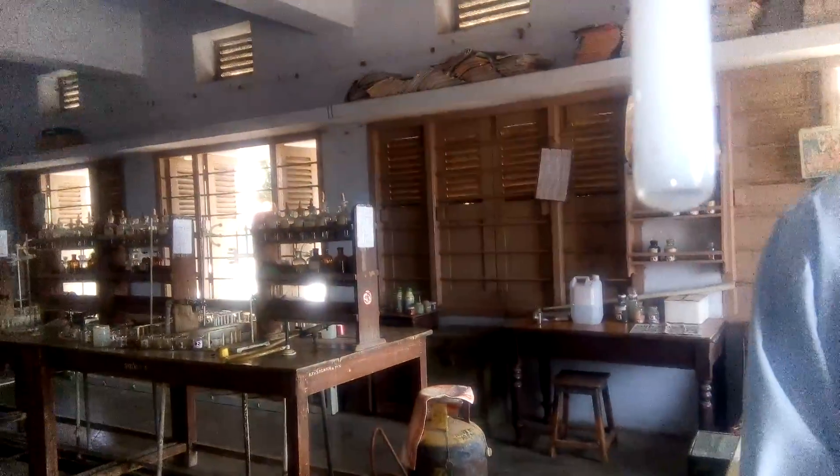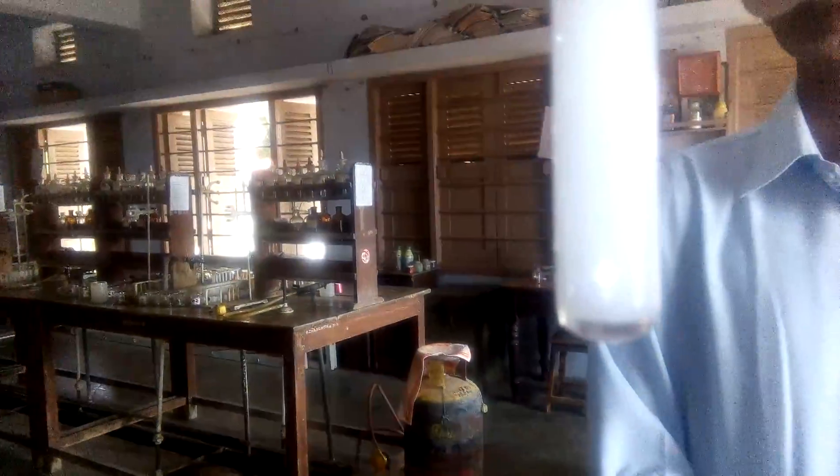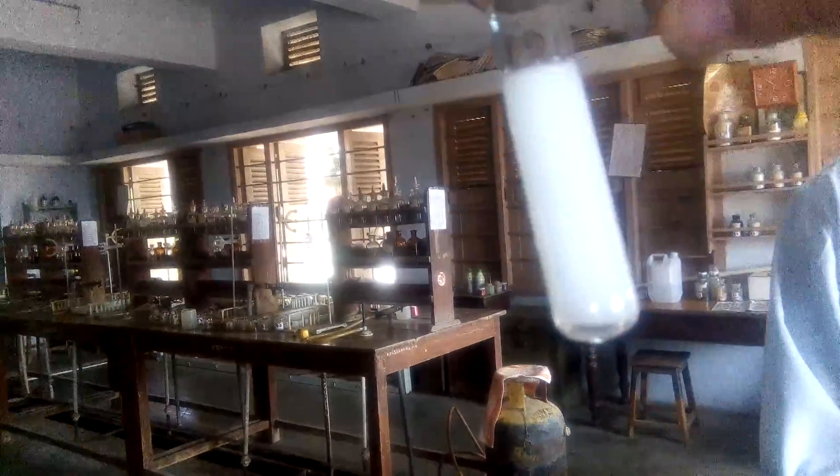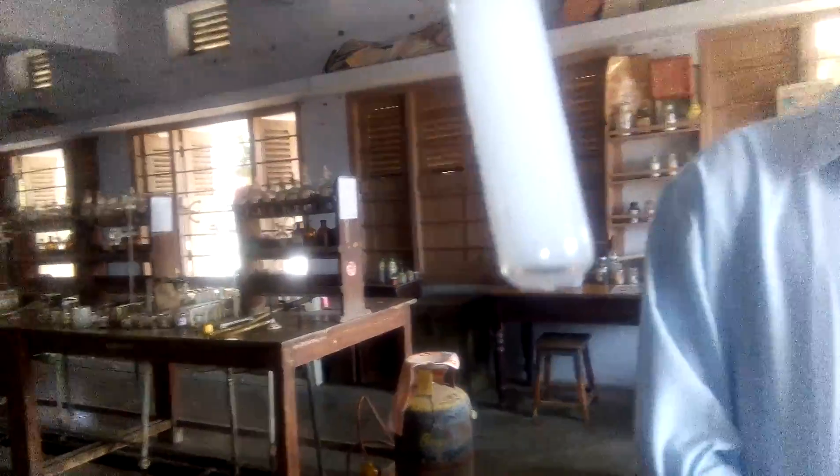At the two separating layers, a brown color ring is produced, and this is the confirmative test of nitrate ion in the laboratory.